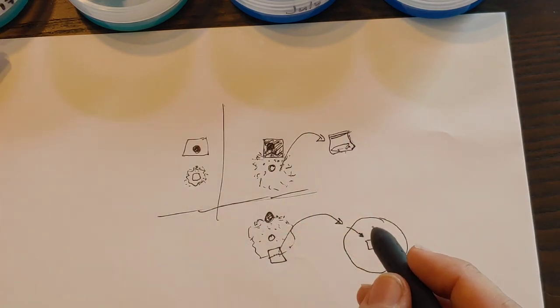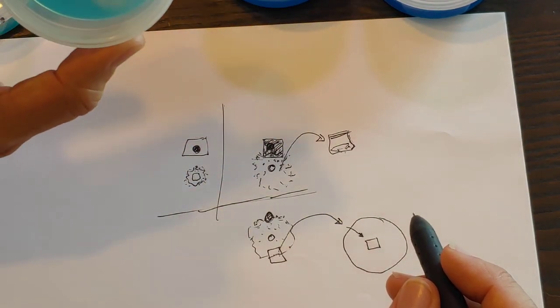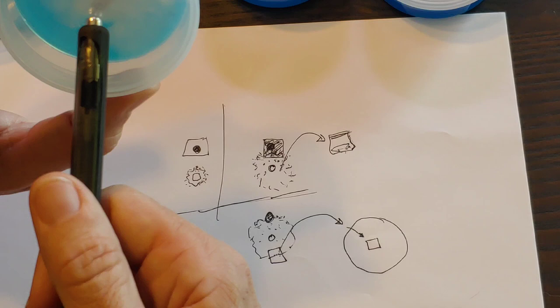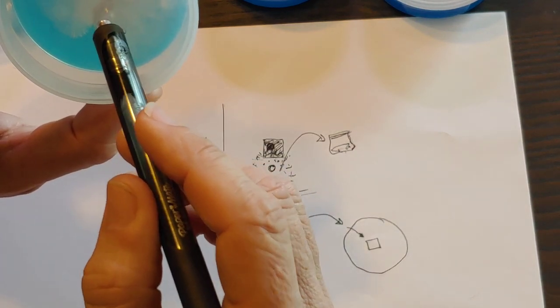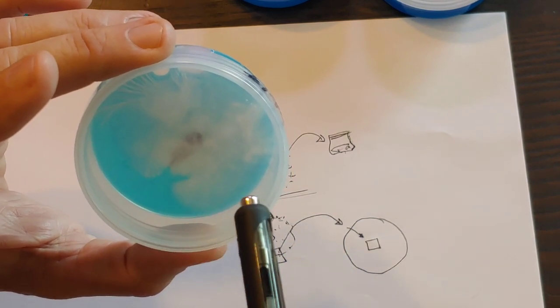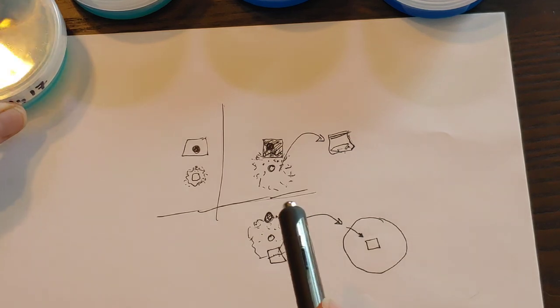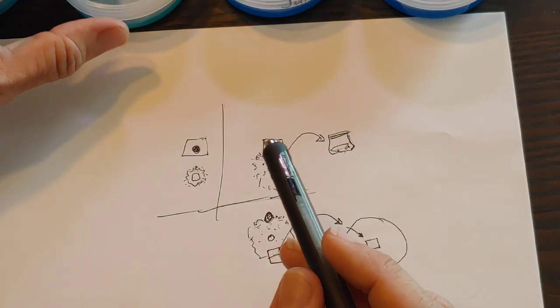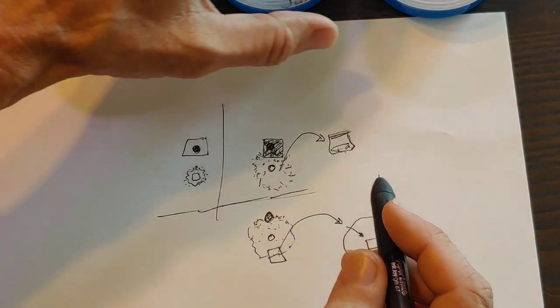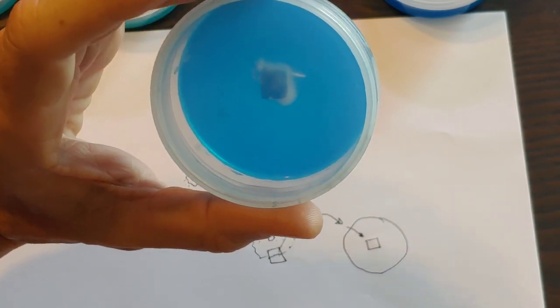Also, another thing is, don't put all your eggs in one basket. If you're gonna grow from clone, you do at least 2-3 more transfers. You take like 3 or 4 pieces of your fruiting body. And that way, if one goes really bad, you don't even transfer out, you just toss it. And then you still have 3, or you still have 2, that type of thing. Never put all your eggs in one basket. Never think that, oh, I'm going to do just one agar dish, and that's going to be fine. Always do at least 2-3, even more.